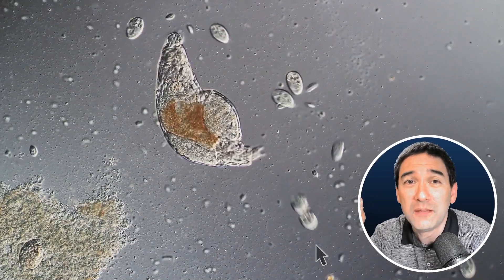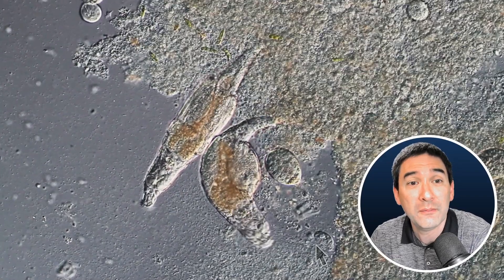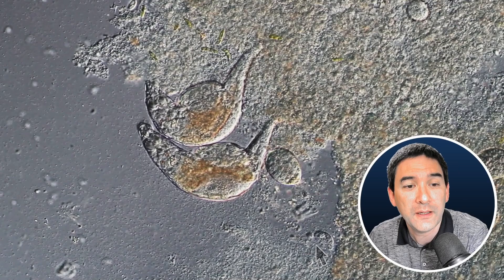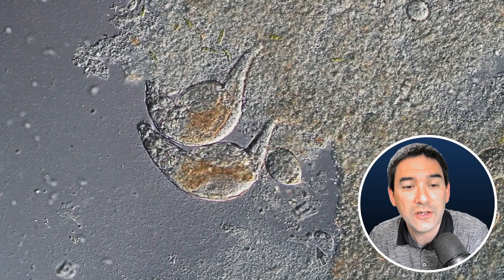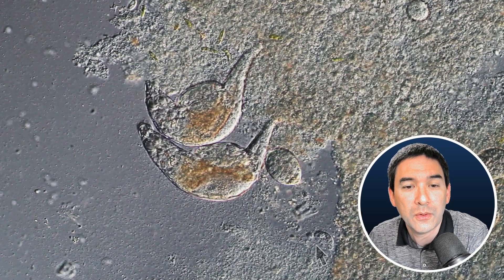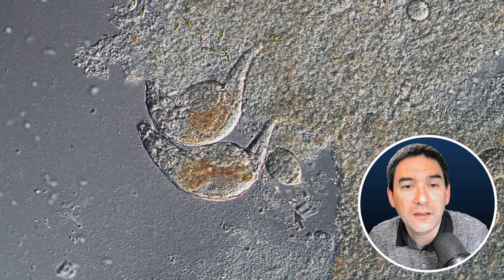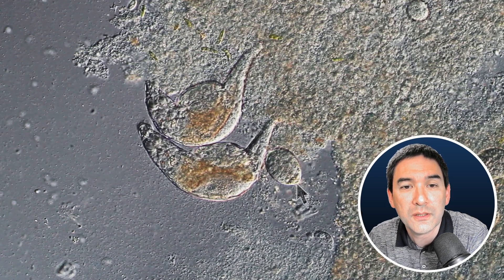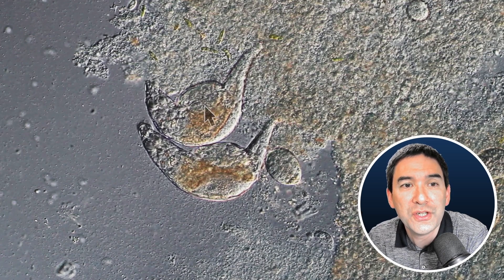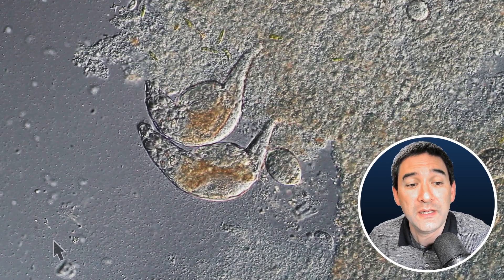Way too thin and below the resolution limit of light microscopes. So what we have over here are two rotifers, nicely visible. Also nicely visible are the bacteria floating around on the outside, okay? You see some protozoans over here as well, and then two rotifers here, each one made of approximately 1,000 cells, each of the cells not being visible. There are a couple of examples which I'm also going to show you, where sometimes cells are quite easily visible, even though they are kind of packed closely together.